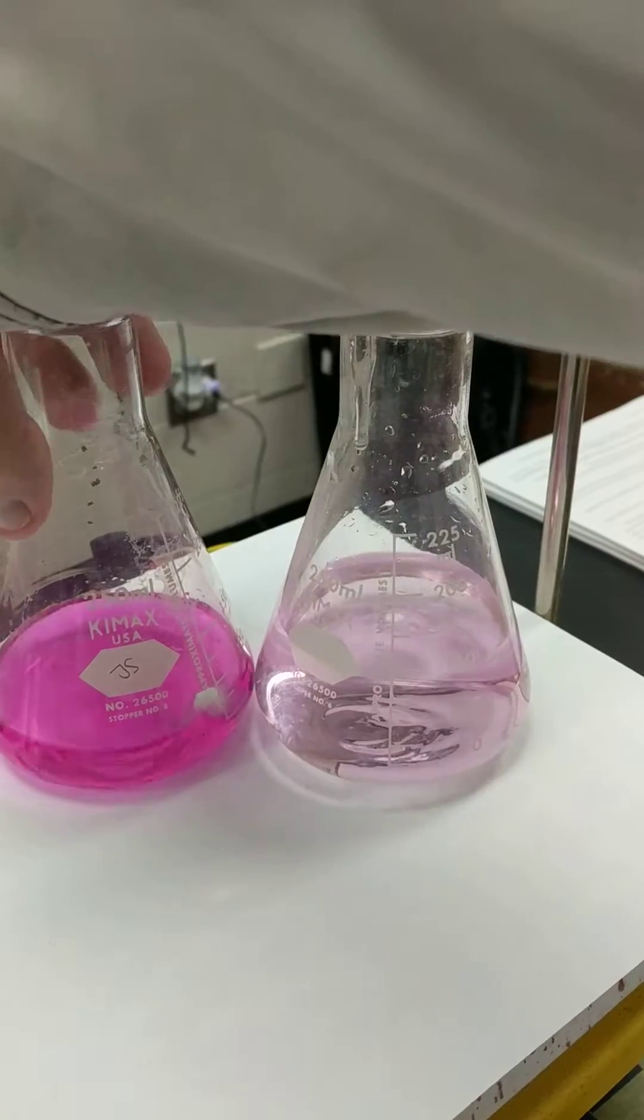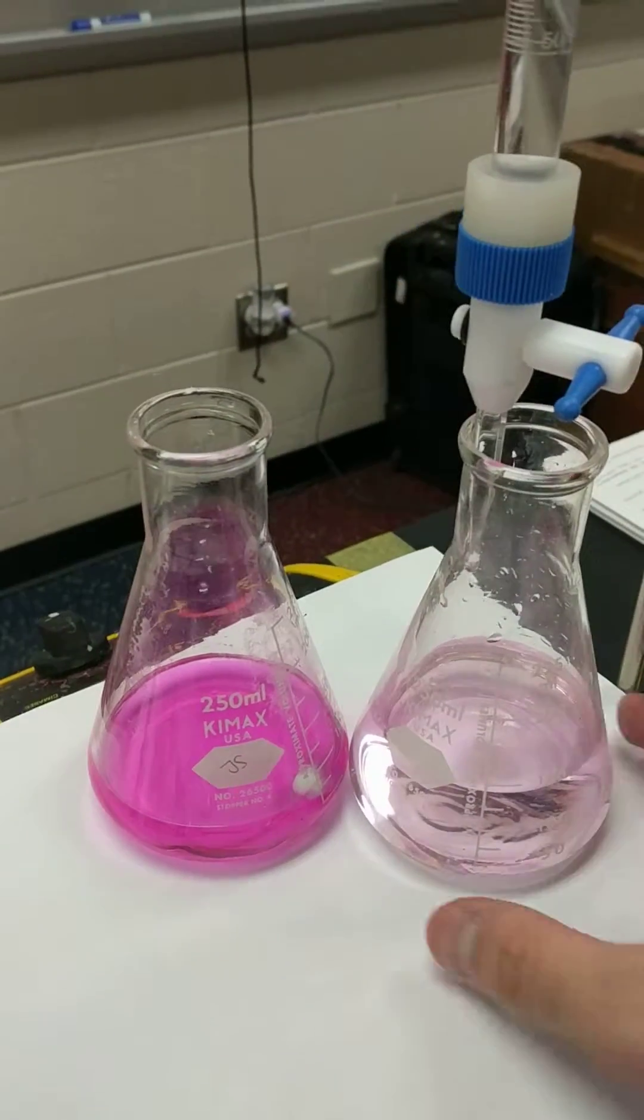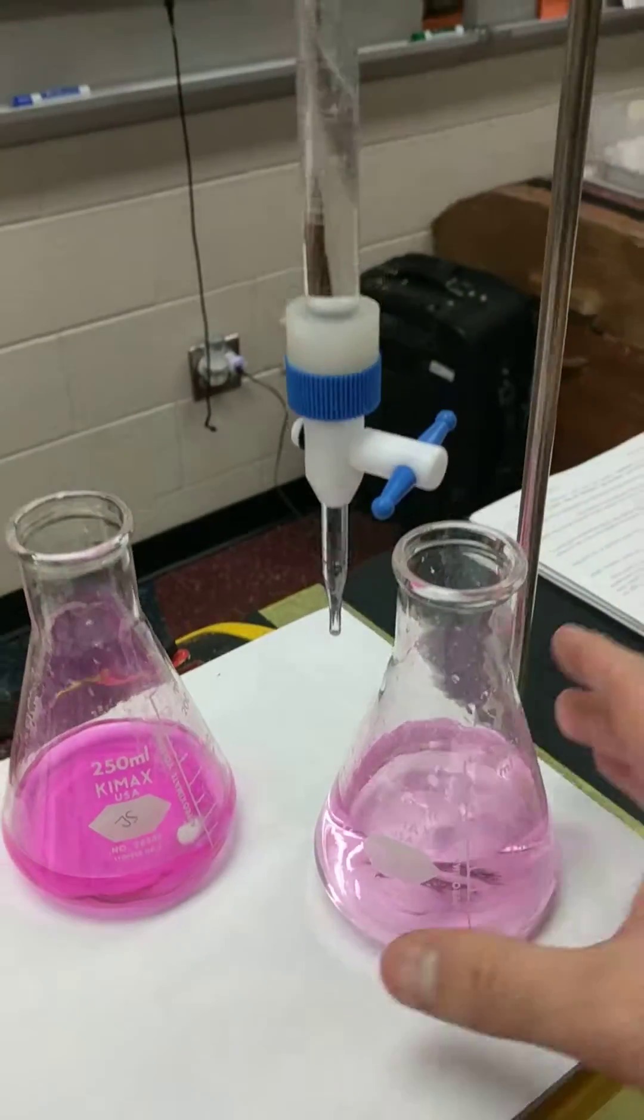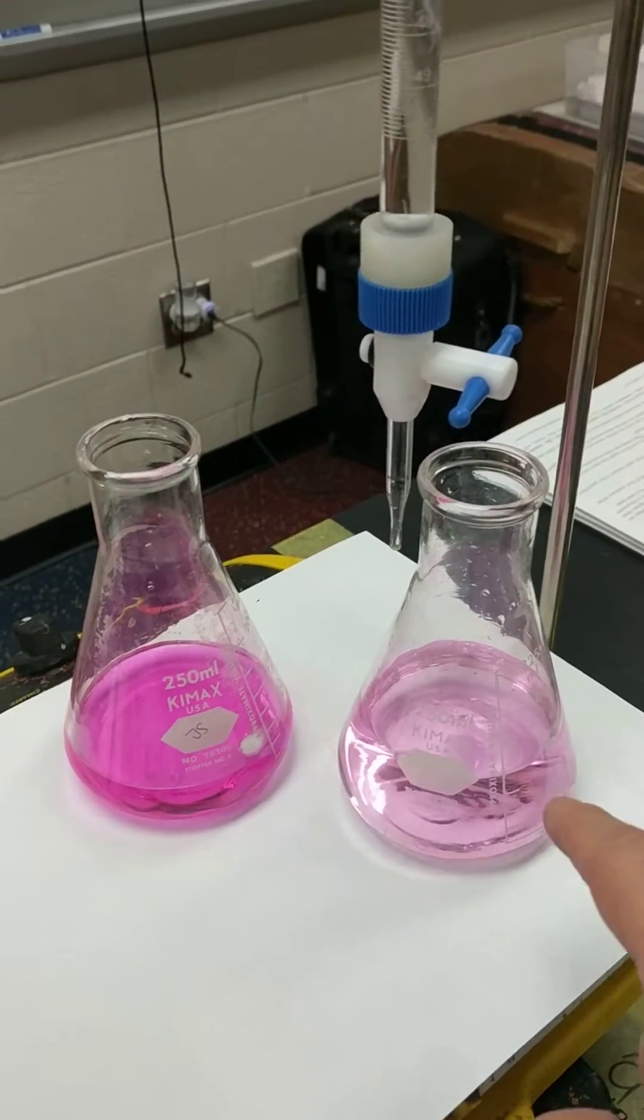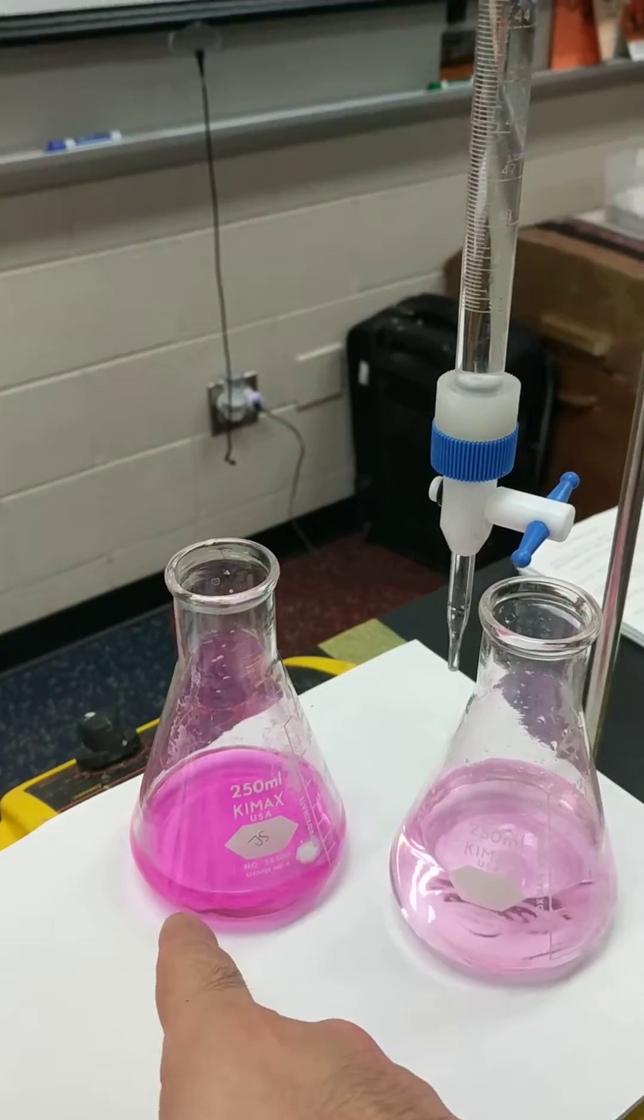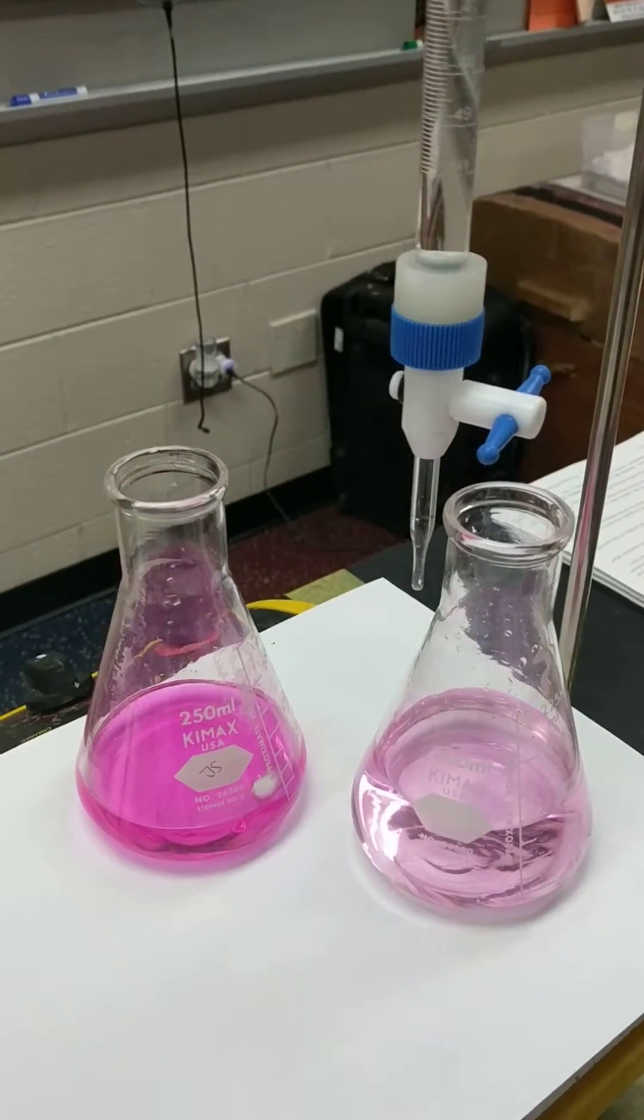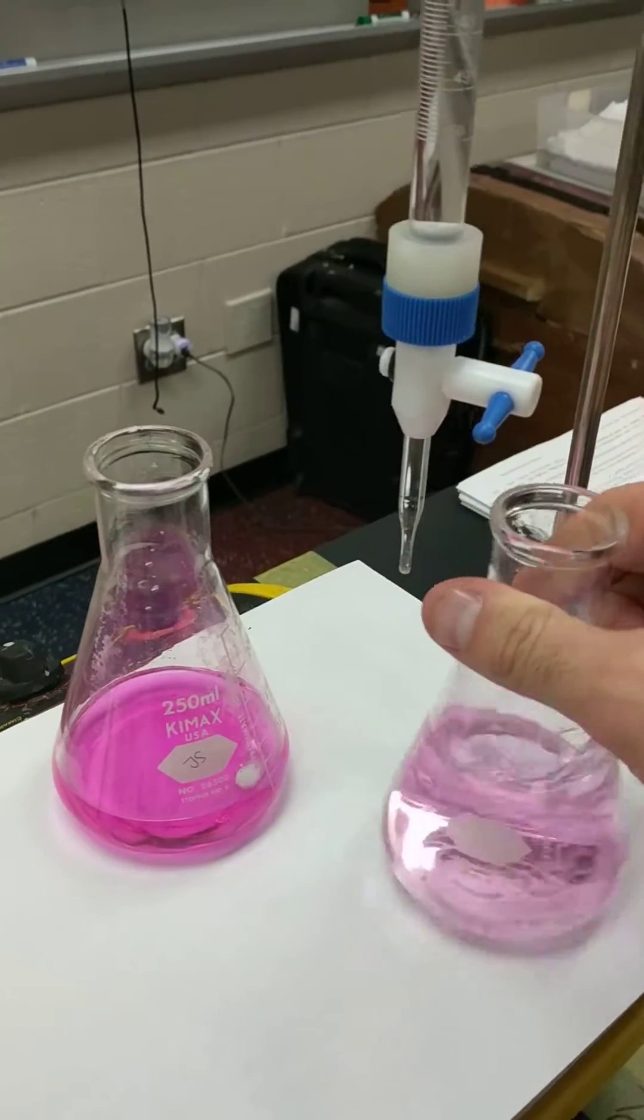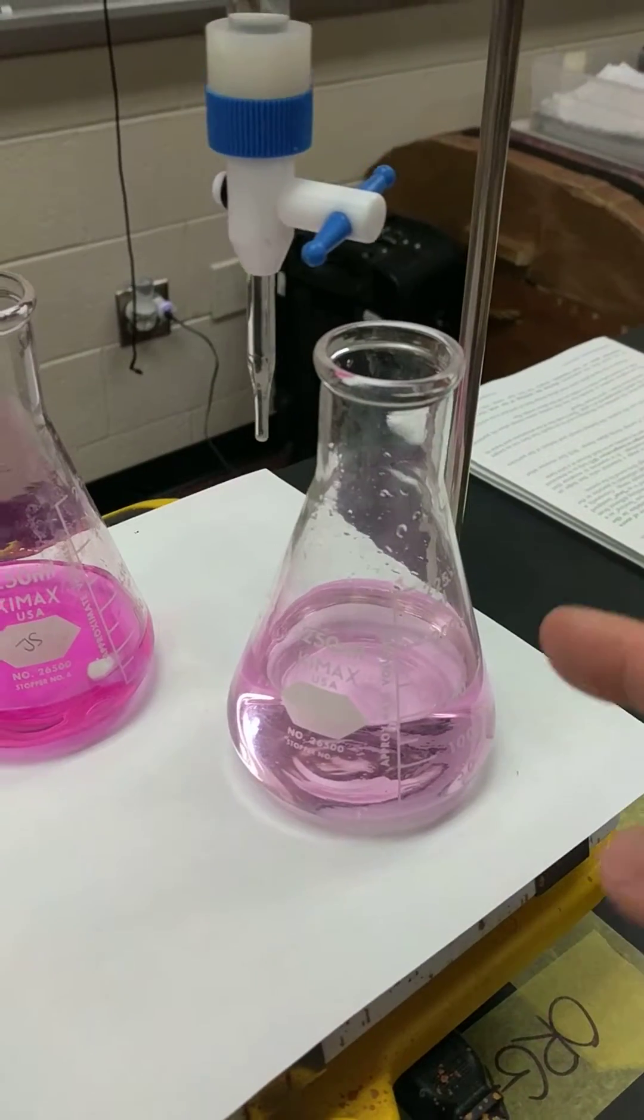I have two things side by side here. This is way too far. This is beautiful right at the end. You want a faint pink endpoint. If I add any more sodium hydroxide, it's going to make my solution a little bit darker, right? So I accidentally added like another drop in there if you saw it. You want your endpoints to look like this, not like this. This is way too far, and in that case, my concentration calculations will be overshot and calculated to be higher than normal. So try and go for a fainter. You even want it to be a little bit fainter than this. All right, so this is how you are going to drop at the end to get just at the exact endpoint. You want that faint pink color like this.